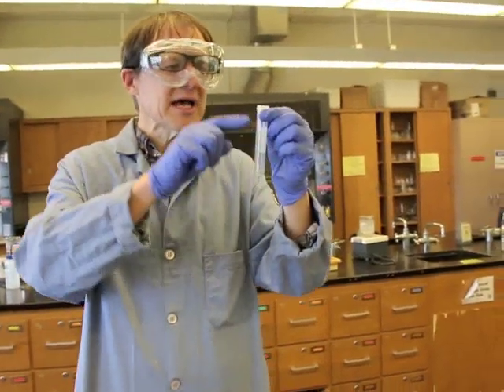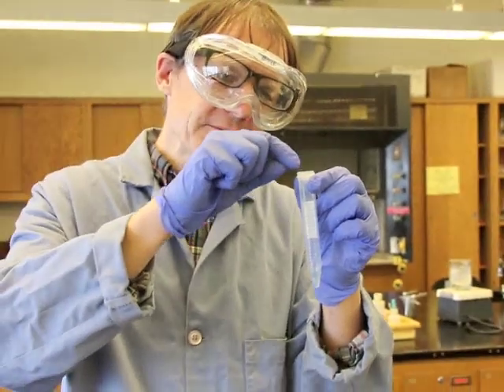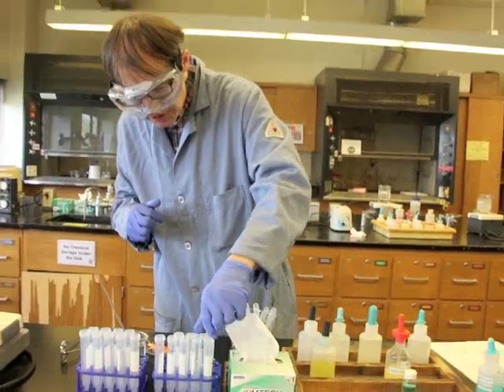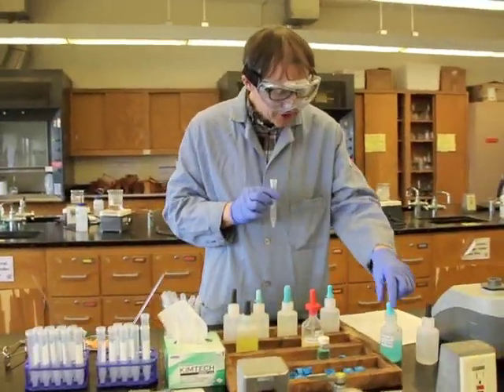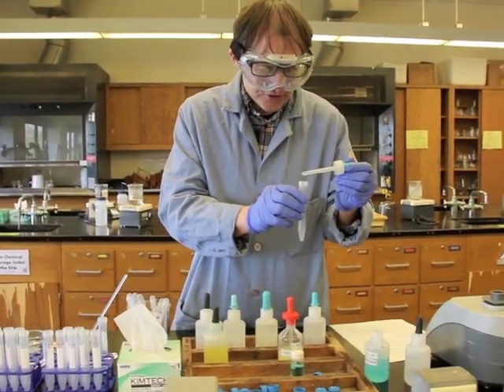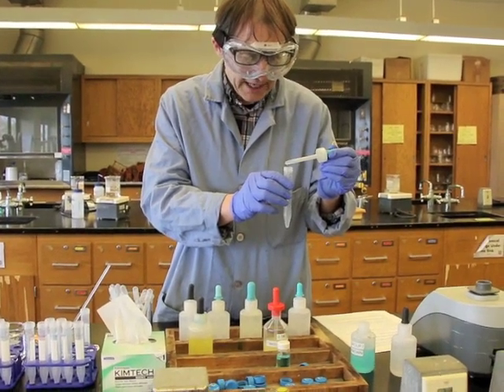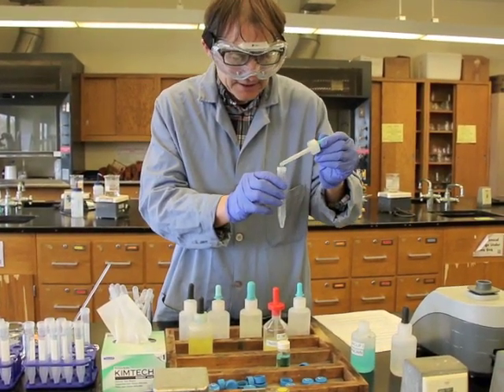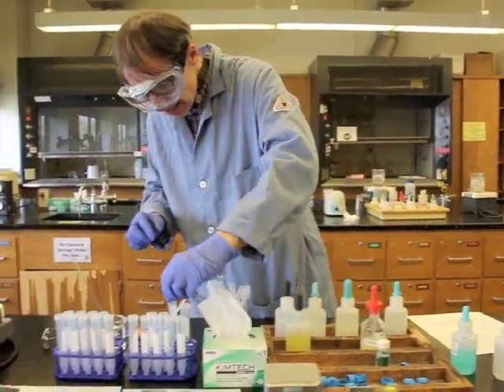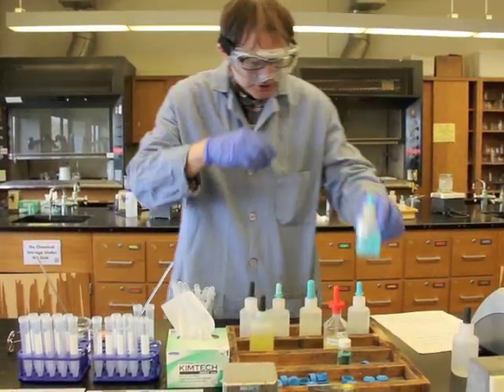Notice that when I dropped it, I paid special attention not to get the drops on the lip. If I were to get them on the lip, I would wipe that off as well as I could. I'm going to put that test tube here. Into another tube, I'm going to drop 5 drops of the group 1 solution. So here's 1, 2, 3, 4, and 5. There we go. It's always good chemical hygiene to close the screw caps as well as you can after you've used it.